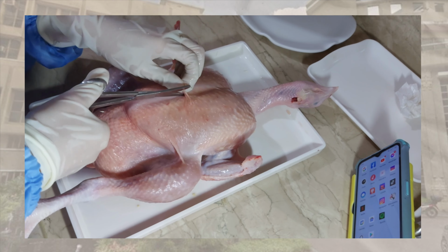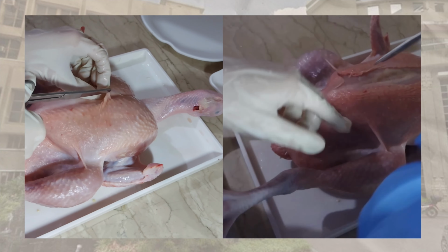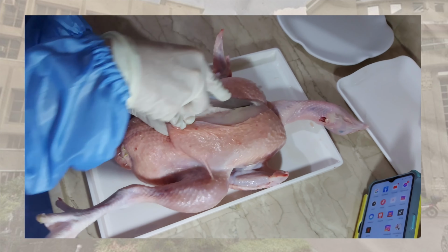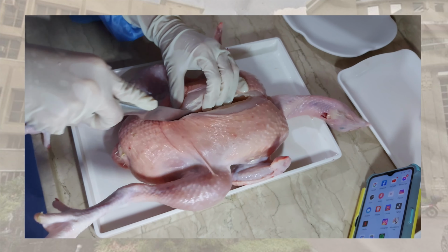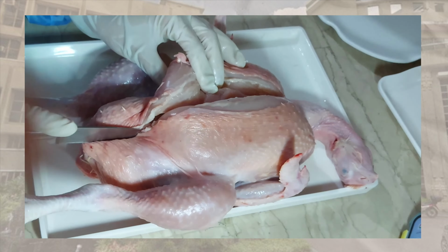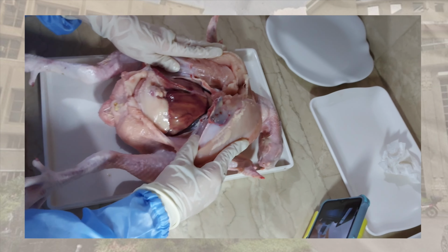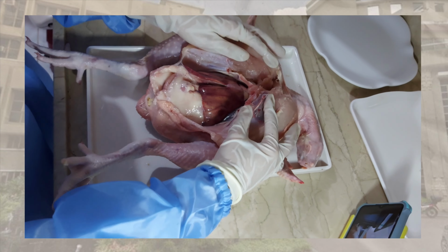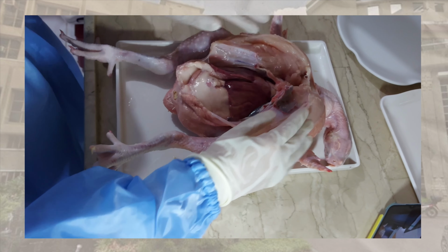She first removed the skin and the chest part of the body, and cut along the longitudinal plane using a mid-sagittal section from the superior portion of the sternal region down to the inferior-most part of the abdominal region. The body is now open, and as we can see, the liver is very large compared to other organs, and it is superior to other parts of the digestive system like the intestines.